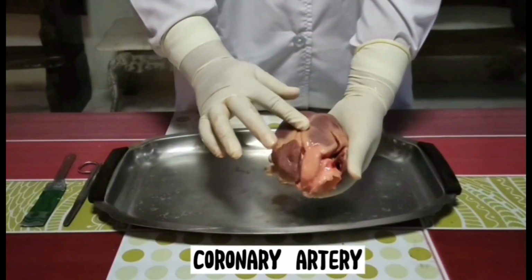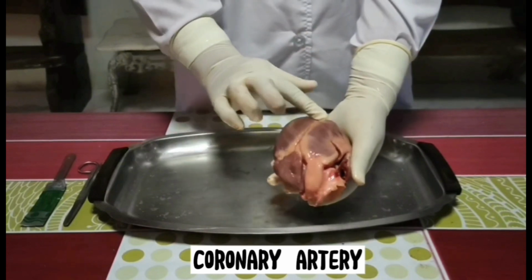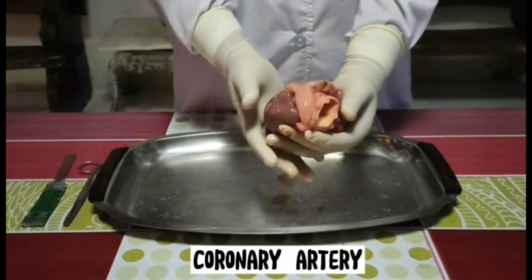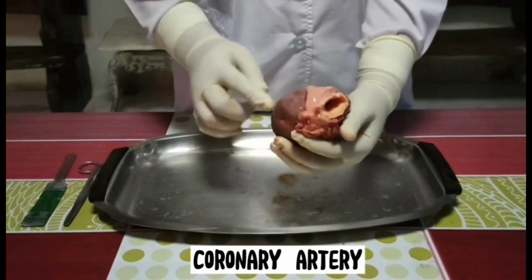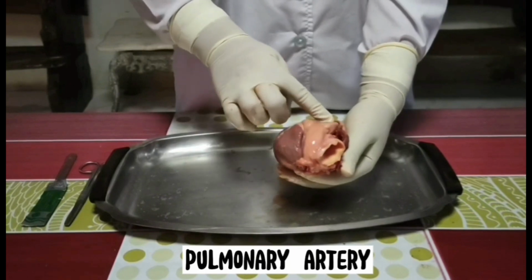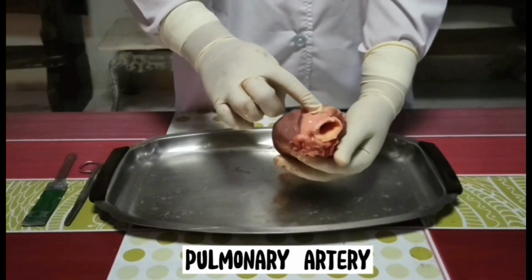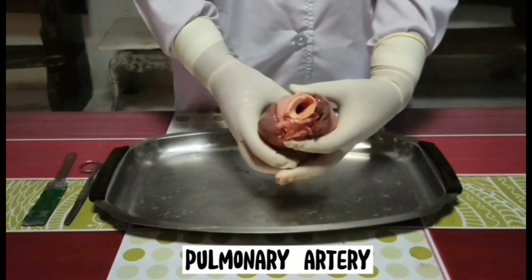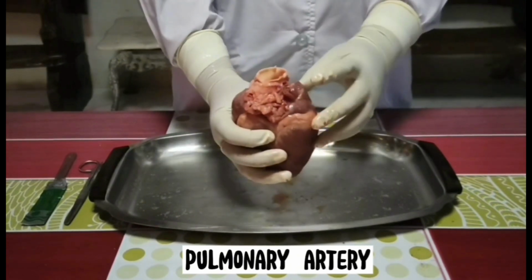This is the coronary artery. These blood vessels lie in the groove on the front of the heart, and it branches over the front and the back side of the heart to supply fresh blood with oxygen and nutrients to the heart muscle itself. Pulmonary artery. This blood vessel branches and carries blood to the lungs to receive oxygen and can be found curving out of the right ventricle into your upper chamber to your left.